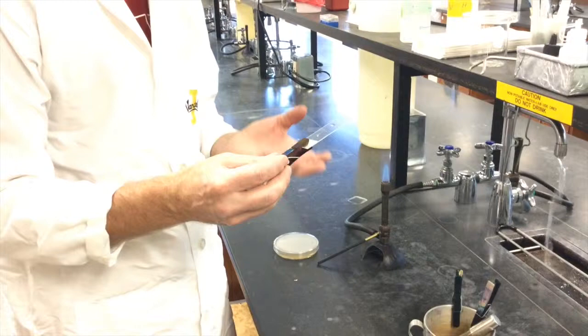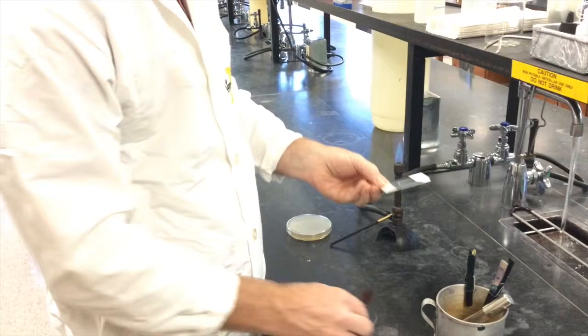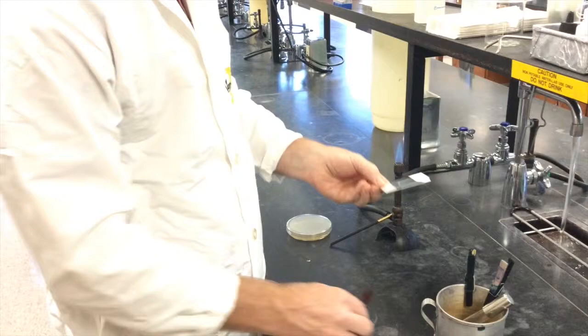You have just now denatured a few proteins on the outside surface of the cells which are then attached to the slide just like you do when you cook egg whites. They can stick to the pan when you heat them up. Same idea. We're not heating it so much that the cells burst and leave cell debris behind. That's heat fixed now.